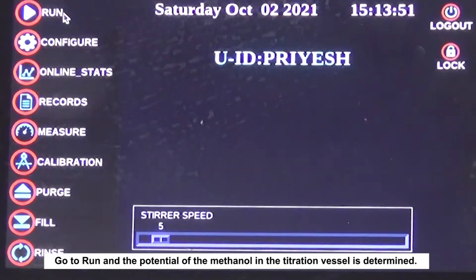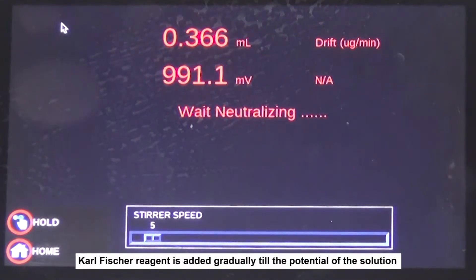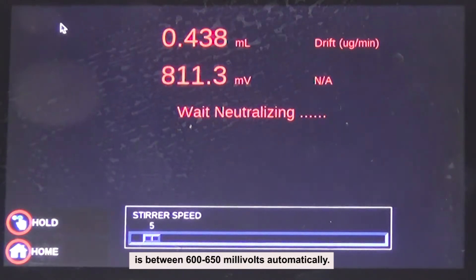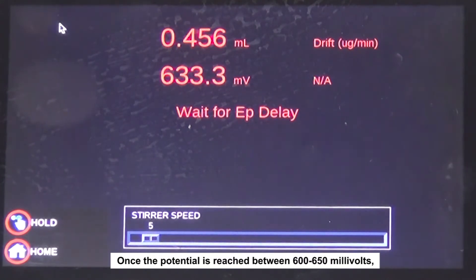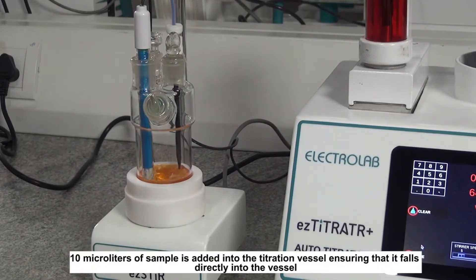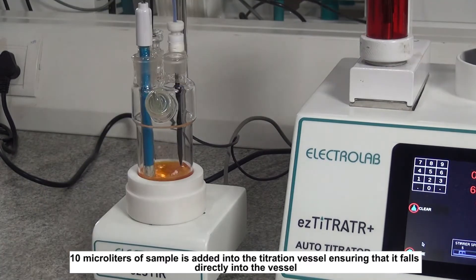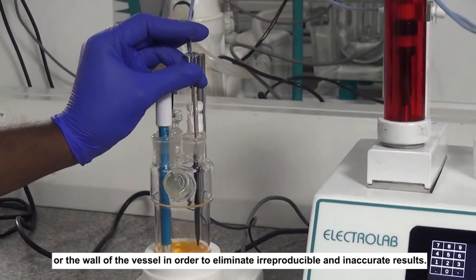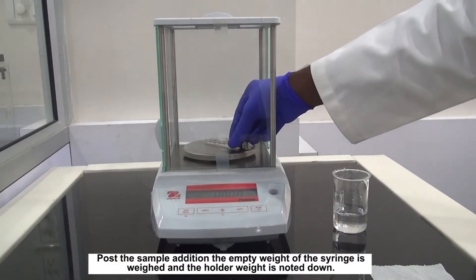To start the analysis, go to Run. The potential of the methanol in the titration vessel is determined; Karl Fischer reagent is added gradually until the potential is between 600 to 650 millivolts. Once that potential is reached, a window for the addition of the sample weight is displayed. 10 microlitres of sample is added into the titration vessel, ensuring it falls directly into the vessel and not at the electrode or the wall, to eliminate irreproducible and inaccurate results. After sample addition, the empty weight of the syringe is weighed and the holder weight is noted down.